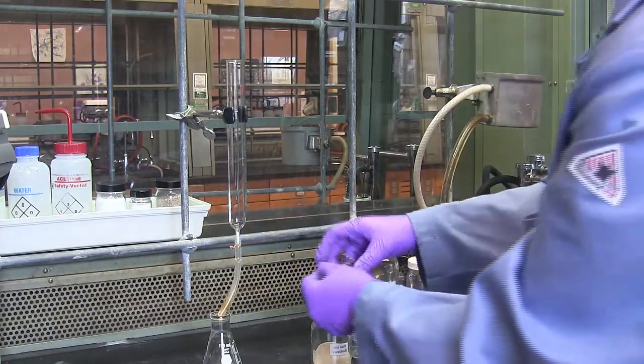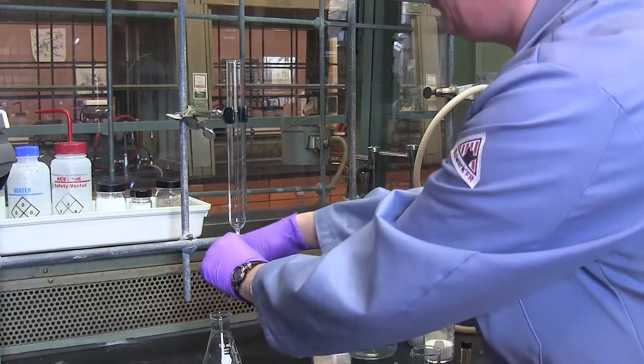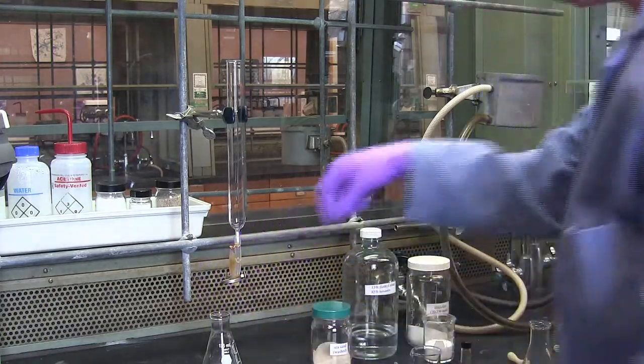First thing I'll need to do is add a pinch clamp to the tubing. To get the flow to actually stop, I'll need to double up the tubing as such.